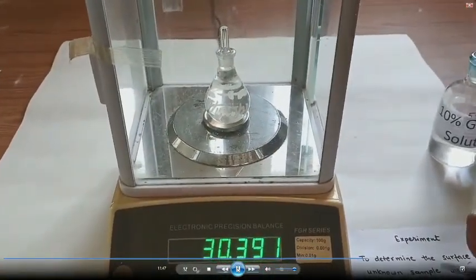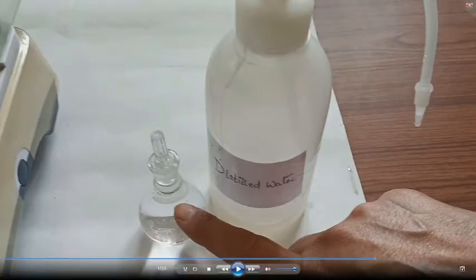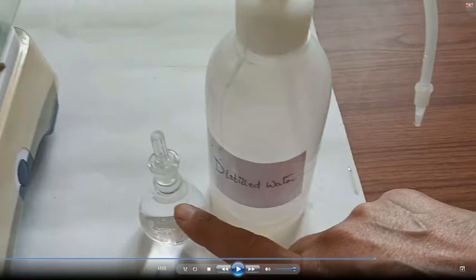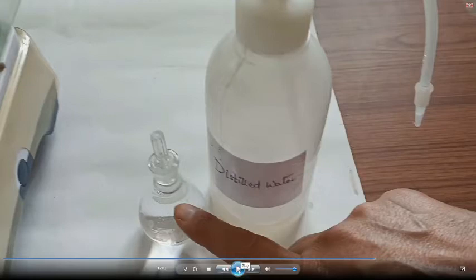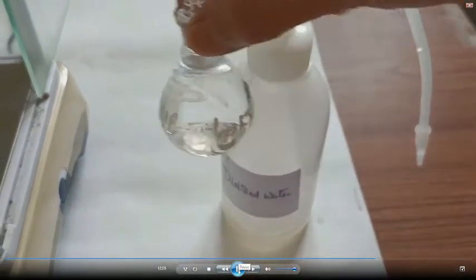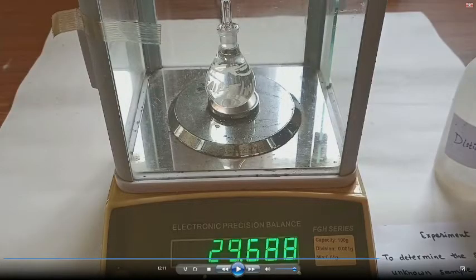This is the weight of the 10% glycerine solution. We took glycerine first because after transferring the glycerine solution to the reagent bottle, we wash the density bottle thoroughly with distilled water two or three times. After washing thoroughly, we fill it with distilled water so the density is not affected. Now we take liquid one — water — in the density bottle and record its weight.